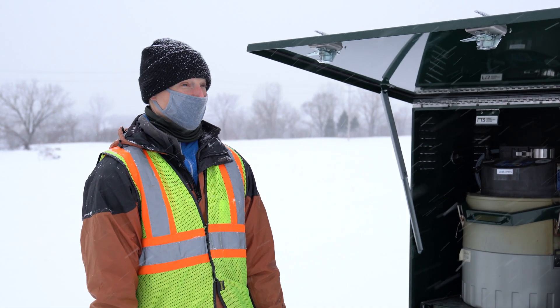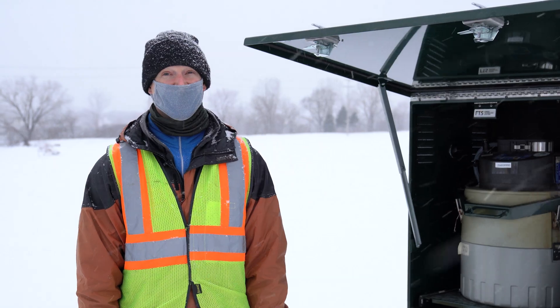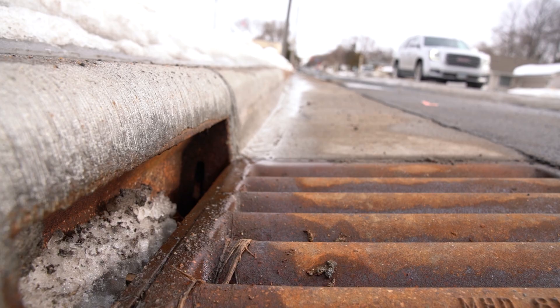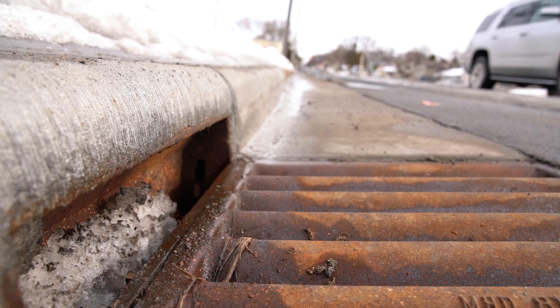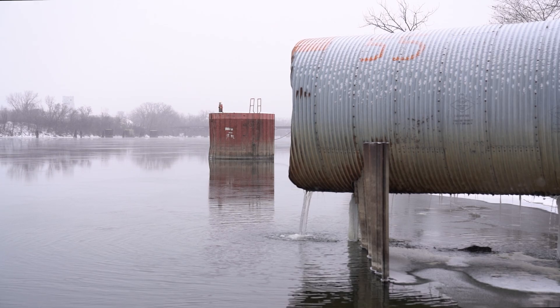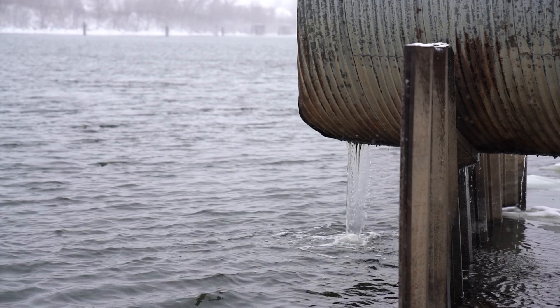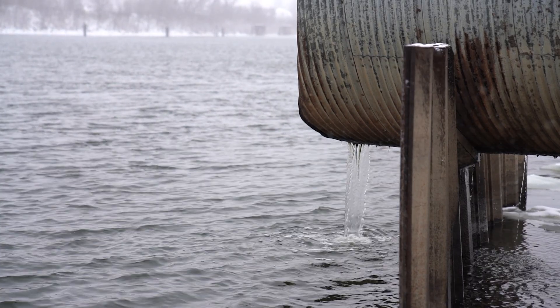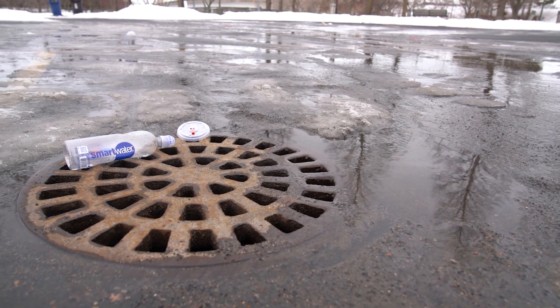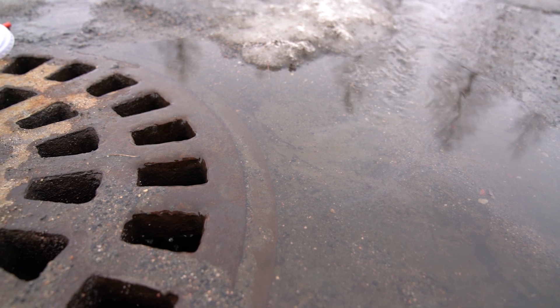This equipment is used to monitor the pollution in stormwater runoff. Anything that you see on the streets and sidewalks and yards is going into the stormwater and then into the river. What we want to do is look at those pollutants and target their sources so that we can minimize that pollution that's running to the river.